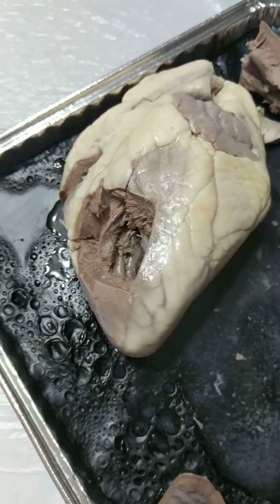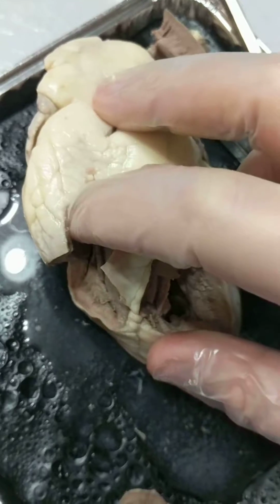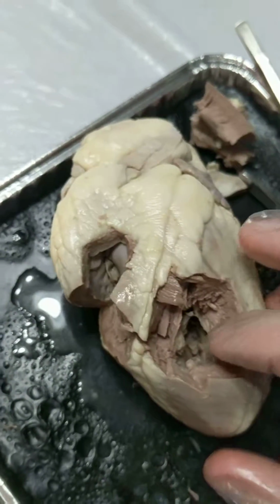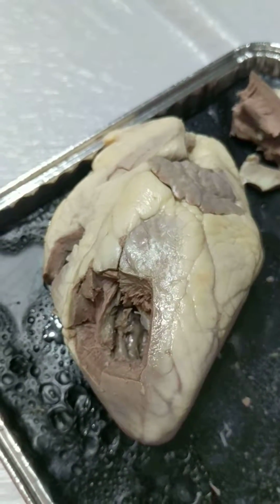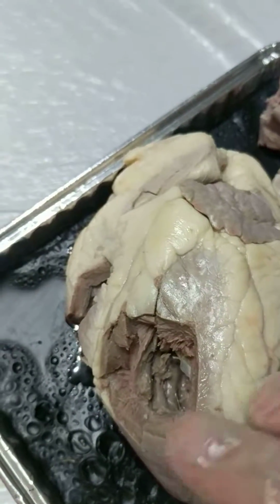The papillary muscles are what you can see the chordae tendineae actually being attached to, if you can see them in there. I'm having a hard time holding the heart and camera at the same time. The semilunar valve is a valve between the aorta and left ventricle. That's what I was saying that we actually ran a probe down through.